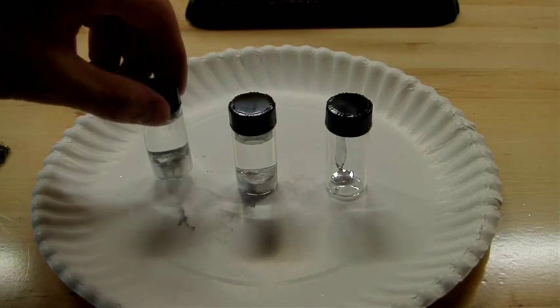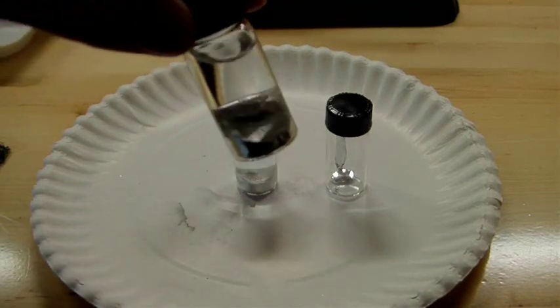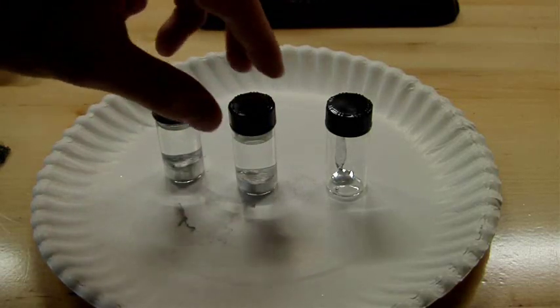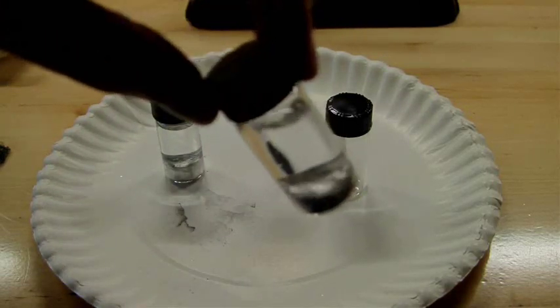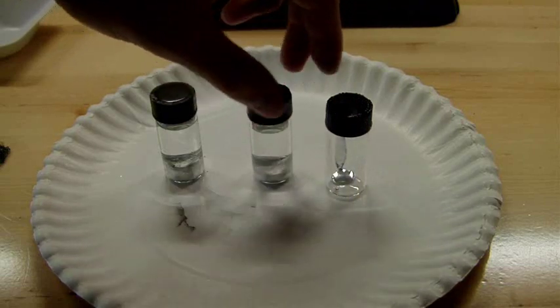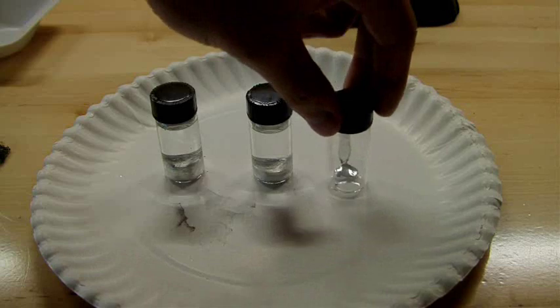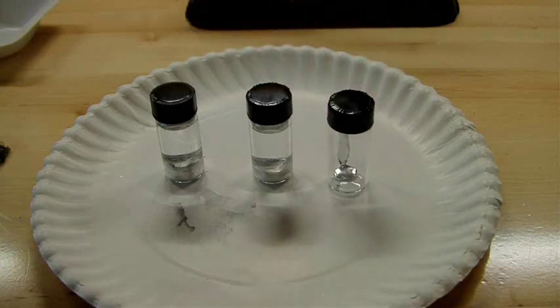All right, so here's my samples all ready to go. Here's the one in the oil. There's the one that's in water. You can see that all these are still liquid now that they've cooled down to room temperature, and that's the one that's in air. Not a whole lot in there.